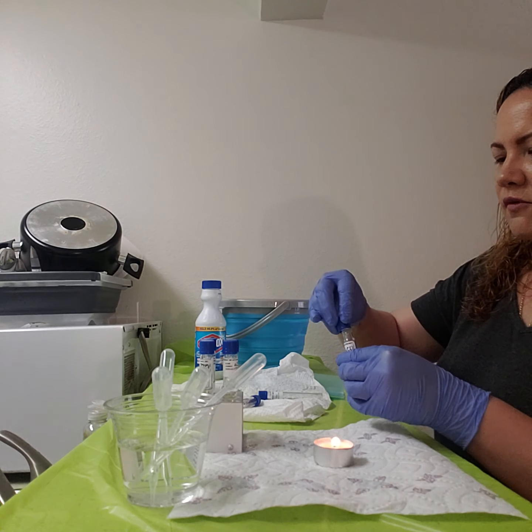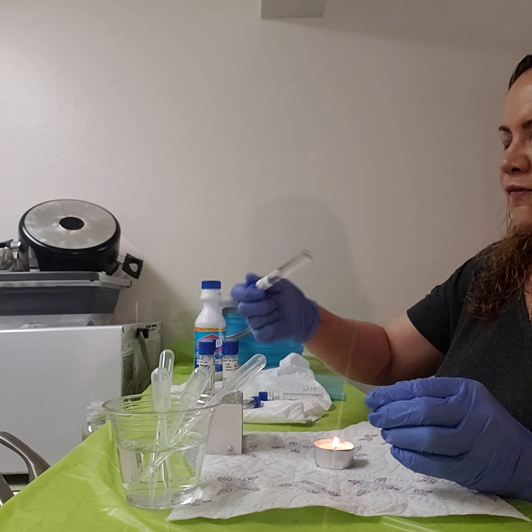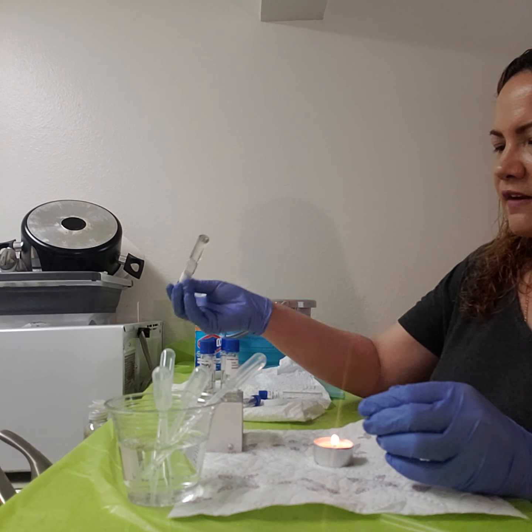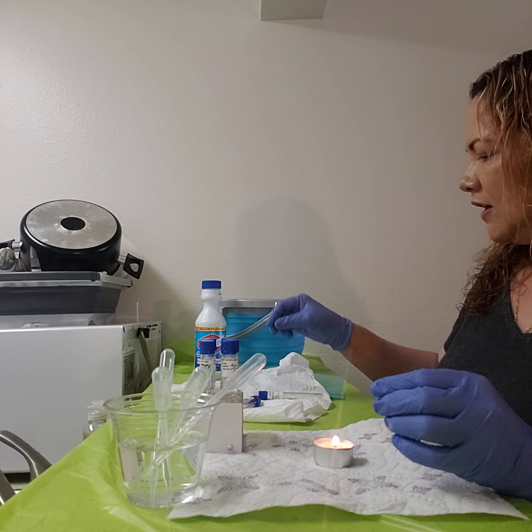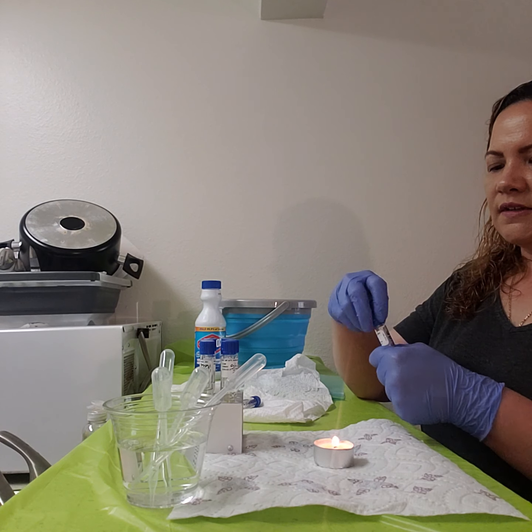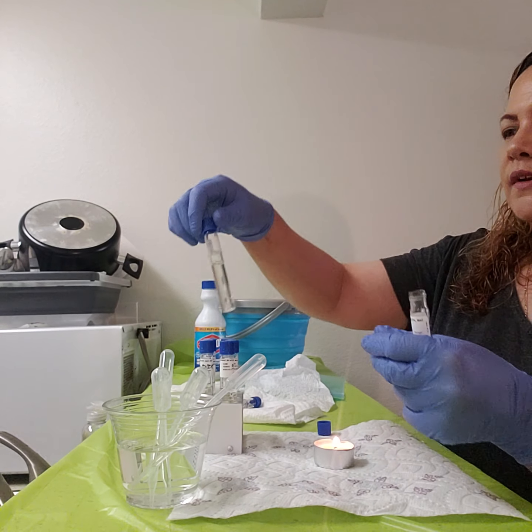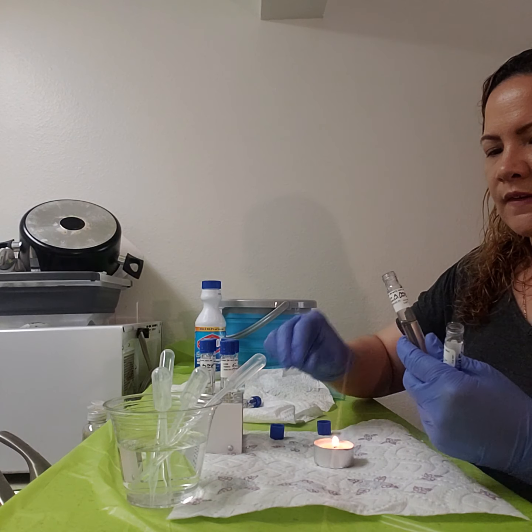And I want to remember to do the most important part, which is to move the vials back and forth after each one, because it actually mixes together. Okay, so next I have the S. cerevisiae. So I'm going to go ahead and sterilize the top of this one. Okay, and then here we go. I'm using the 1%. I already have it labeled. Okay, same thing.